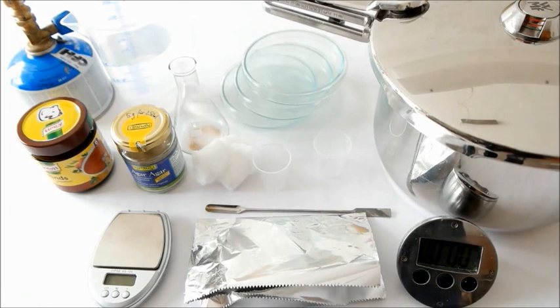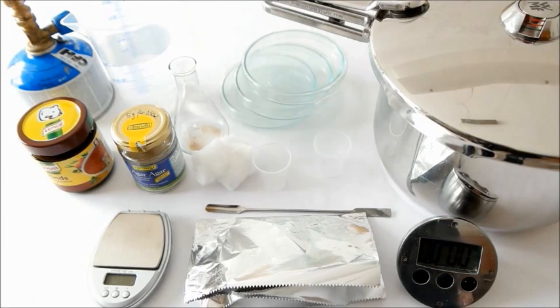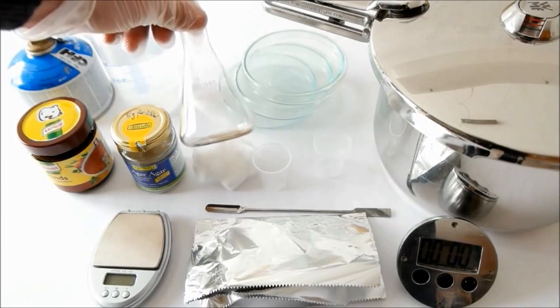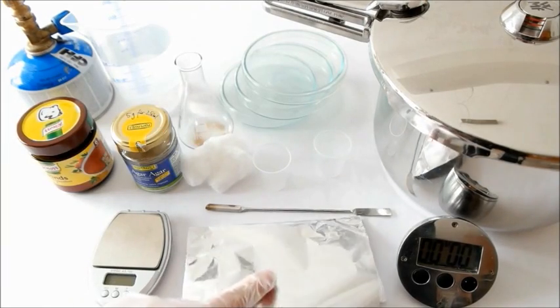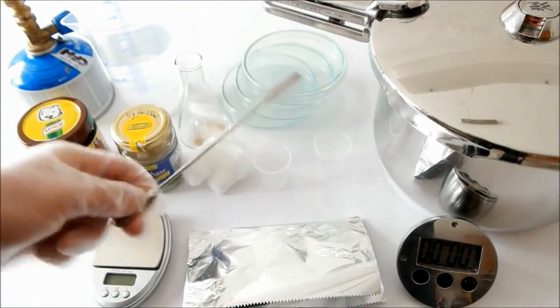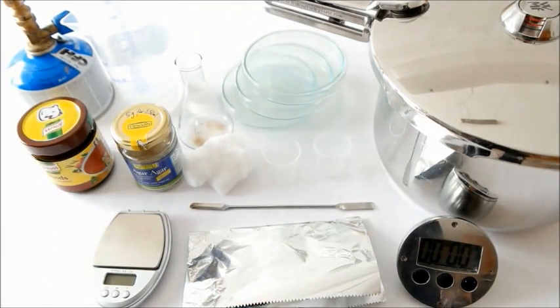Apart from that you need some petri dishes of course. I used pretty big ones, three of them, and a 100 ml Erlenmeyer flask, some cotton, aluminum foil, a spoon or something like that, and two cups to measure out the ingredients.